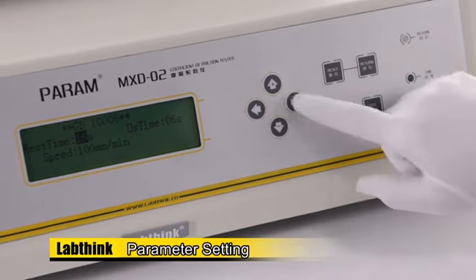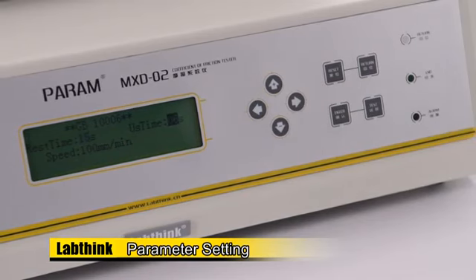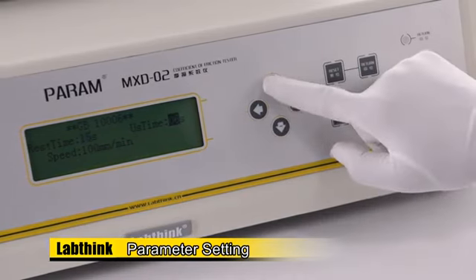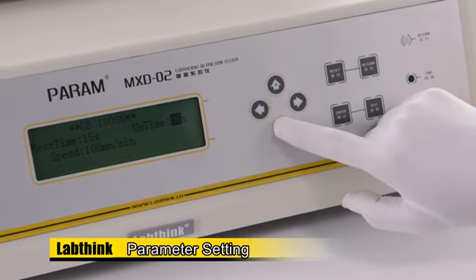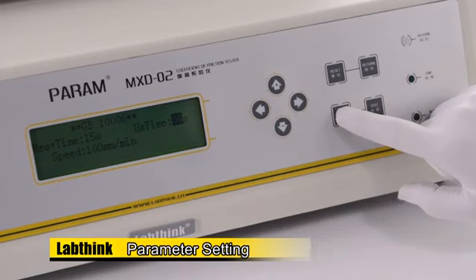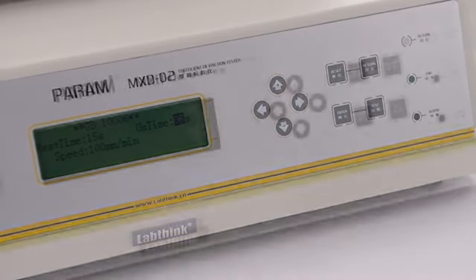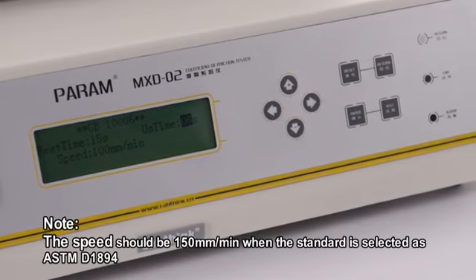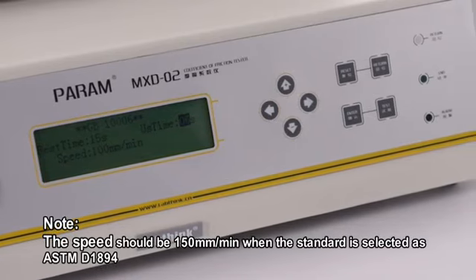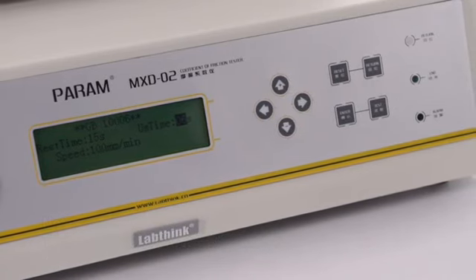Set US time as 6 seconds. The data collected in the first 6 seconds will be used to calculate the static coefficient of friction, and the data collected in the remaining time after 6 seconds will be used to calculate the dynamic coefficient of friction. The speed cannot be changed, which is 100 mm per minute, required by GB 10006 or ISO 8295.